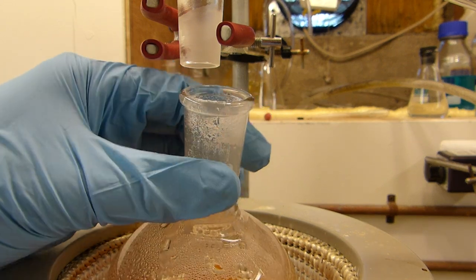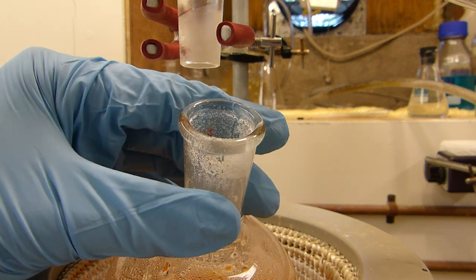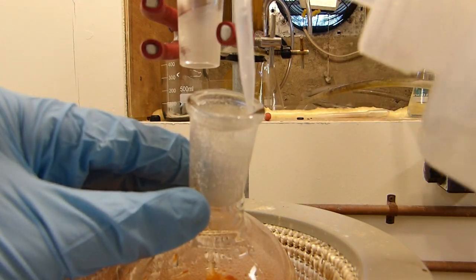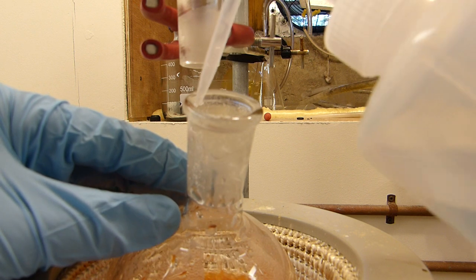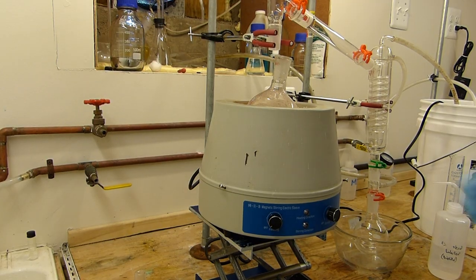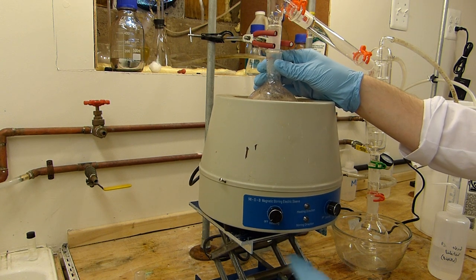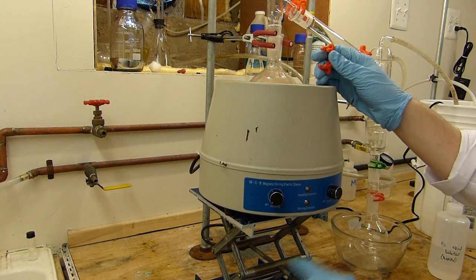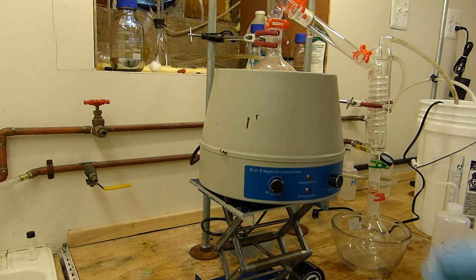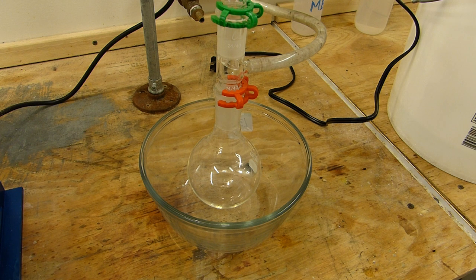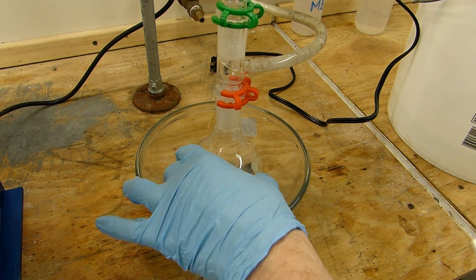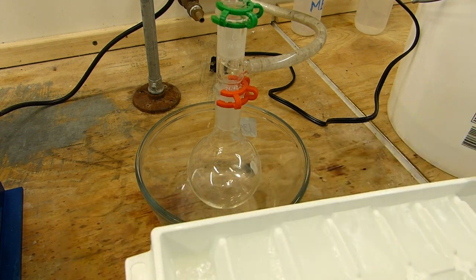If you're like me and you don't have a funnel that goes to the bottom of the flask, you can use a little squirt of distilled water from a wash bottle to wash the bromide from the neck of the flask. I'll now raise the flask into place and secure it with a clamp. While the bromide and sulfuric acid are stirring, we can start to prepare our ice baths.